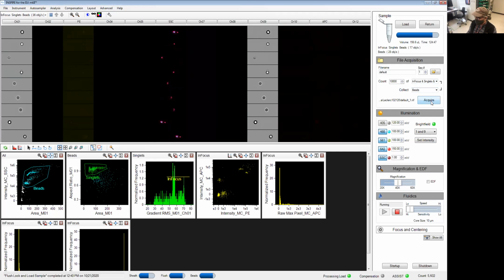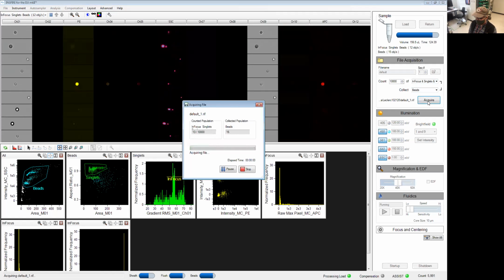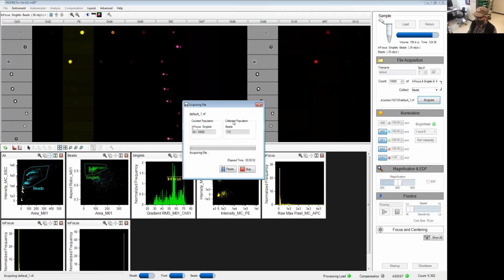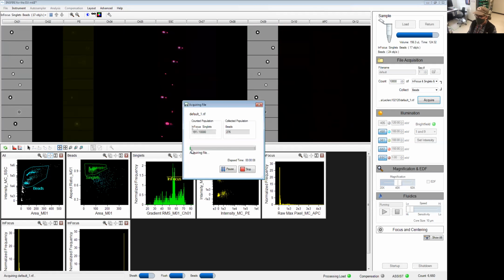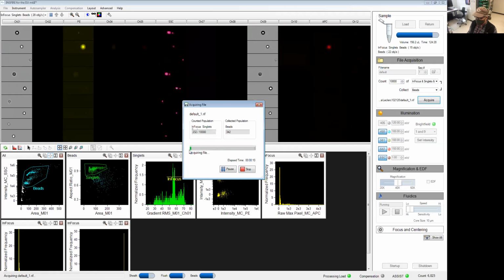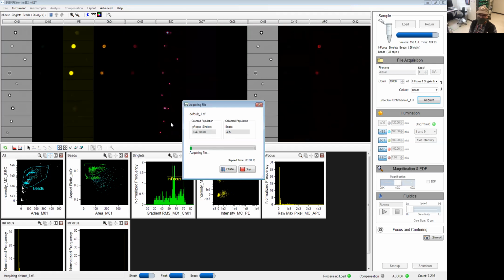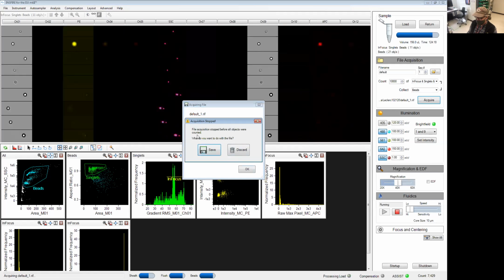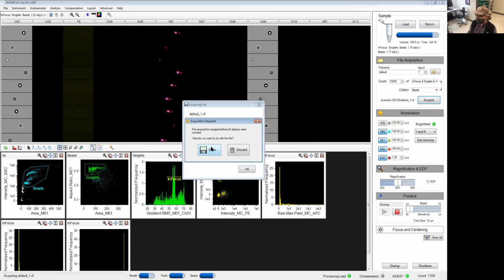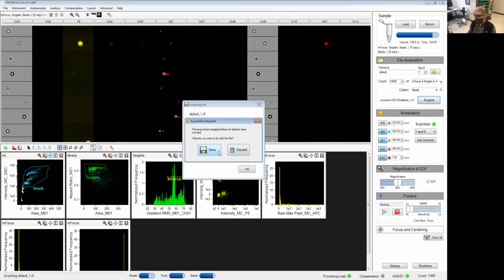Go ahead and acquire at this point, and then we're going to basically let the software record all of the events that we want in our data file. You have the counted region over here and the collected, so what is being saved in your data file. Normally, you're going to reach that limit and the instrument will stop the acquisition on its own. Obviously, we don't really want to wait that long here, so I can actually stop manually and tell the software what to do with the data already saved. I'm going to save it for now. You can also discard it if you made a mistake and want to restart your acquisition.